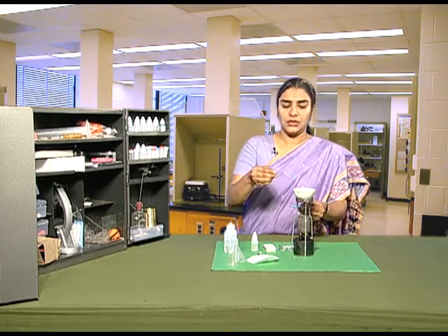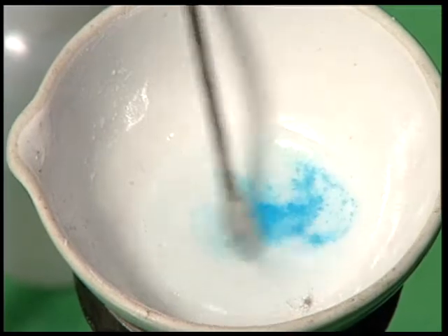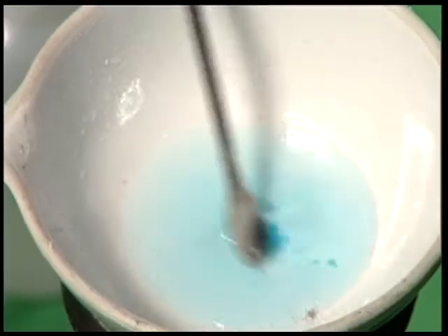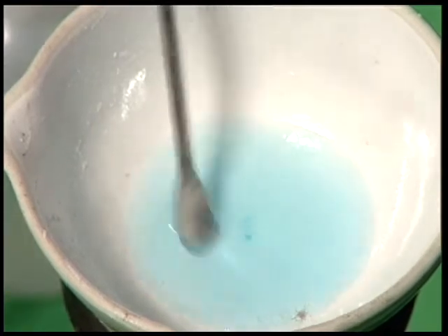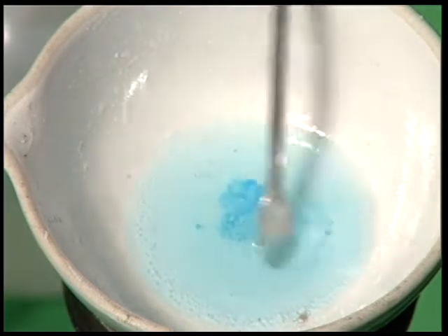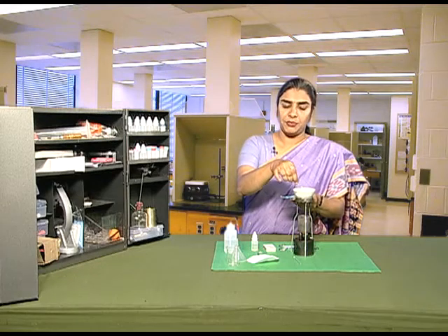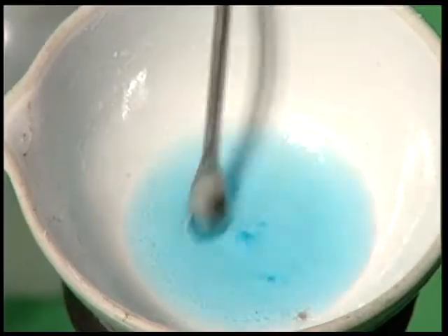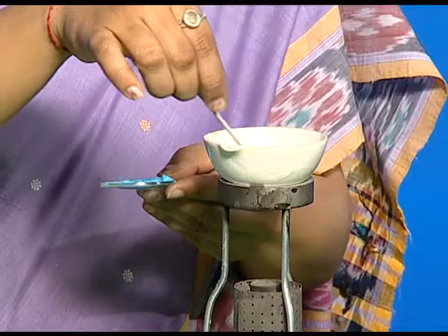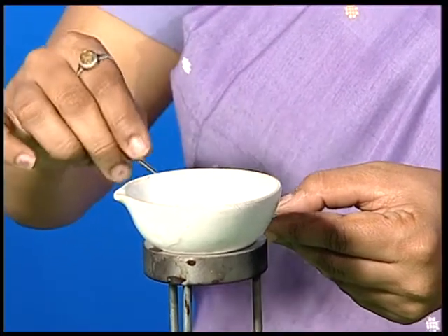To this water, add two spatulas of copper sulphate powder and stir it. As the copper sulphate powder is about to get dissolved, add one spatula more of copper sulphate. Keep on stirring the solution so that the copper sulphate powder gets mixed and completely dissolved in water. Once the copper sulphate gets dissolved and you obtain a clear solution again, add two spatulas of copper sulphate more to the solution.